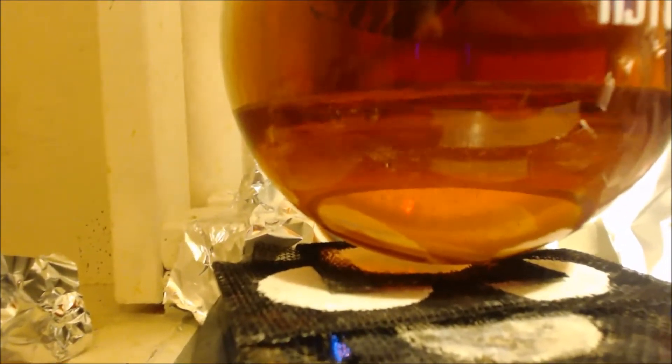I don't really have the fume hood on. I can tell I'm at my buddy's house. We built him a fume hood last year. Actually, maybe it was the year before that. But I don't even have it on now. That's just the condenser you hear right now. Here, let's turn it on. There's nothing there. Down here, you can see a little bit of orange. Oh actually, it's starting to get up into the middle here. Better turn this on.